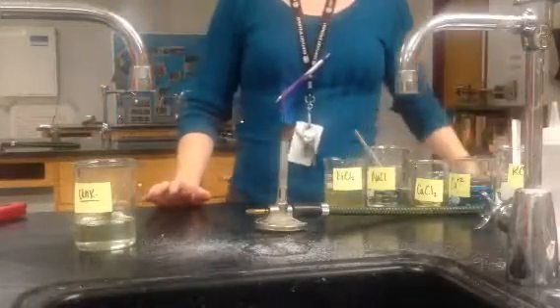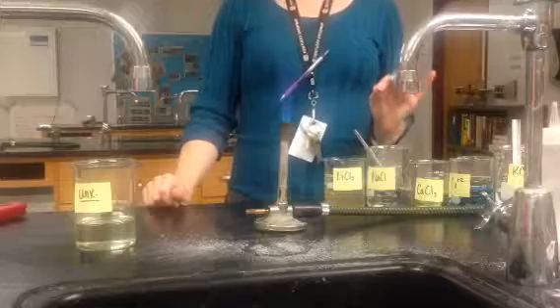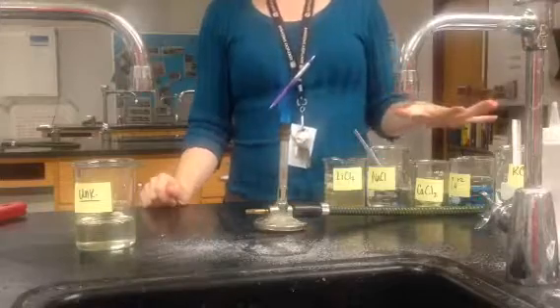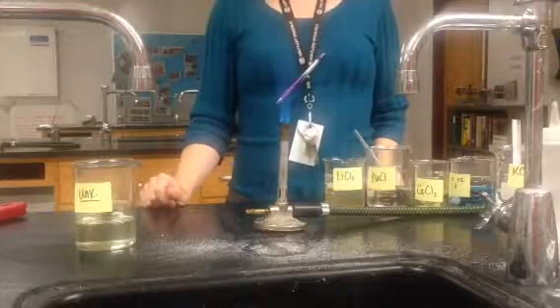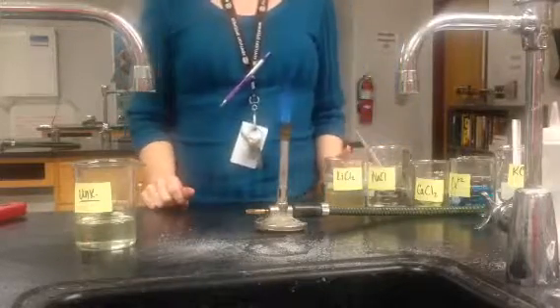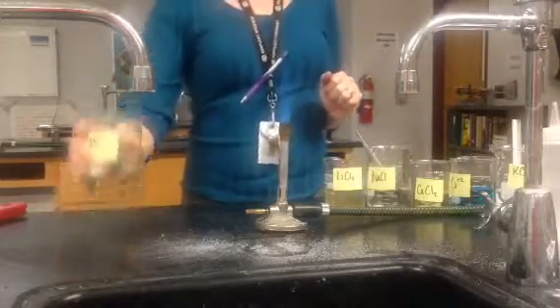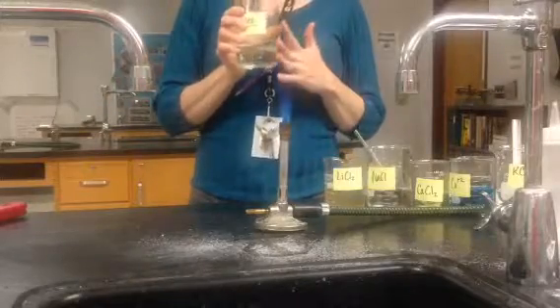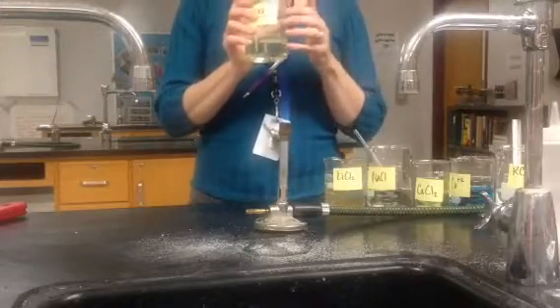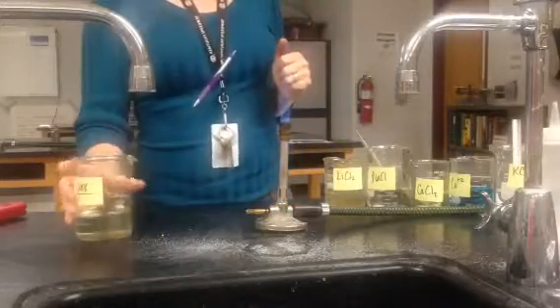Each cation and each atom on the periodic table gives off a spectrum that's just like a fingerprint for us. With the naked eye we may not be able to determine exactly what the chemical is, but there are complex pieces of equipment called mass specs that can determine what a particular chemical is. This is very useful in forensics. Today, you guys were able to take an unknown solution that we pretended had killed one of your classmates — it had poisoned them — and your job was to figure out what cation was the culprit. Let's see if we can do that by watching.